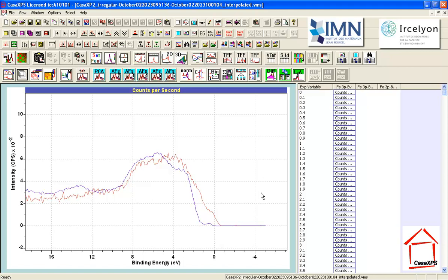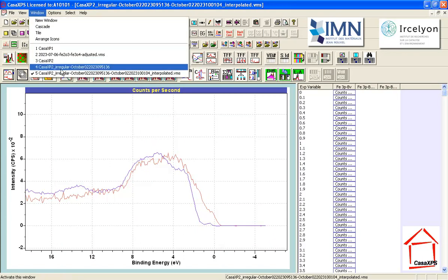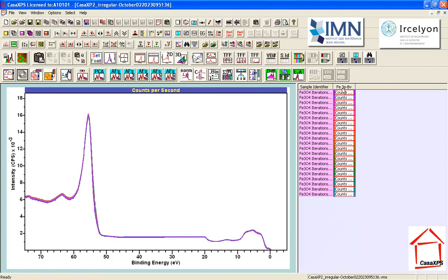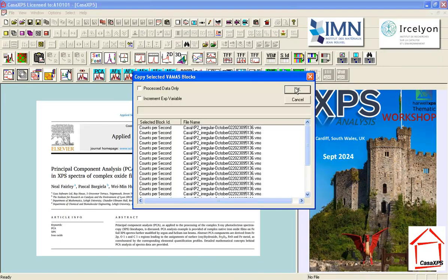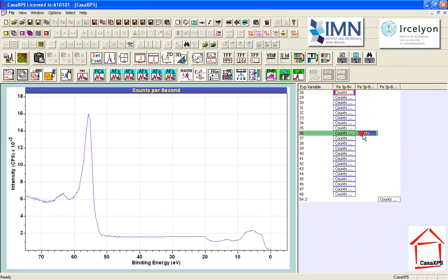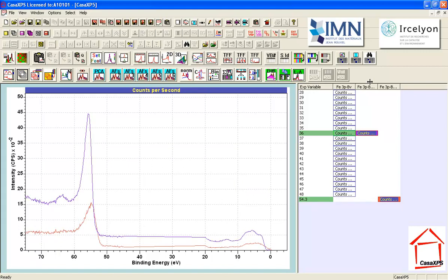It's not the same as I saw with the Fe2O3, but I can identify within the Fe3O4 spectra two different shapes that seem to make some sense in spectroscopic terms, and also highlight a difference between the start and the end of those iterations. So what I'm thinking is that if I now take my data and my two computed forms for the component spectra into a new file, I can just verify that these two component forms are making sense in terms of reproducing the data.